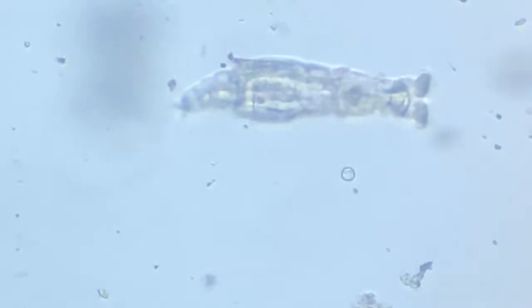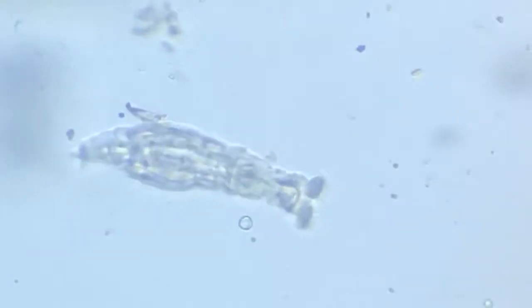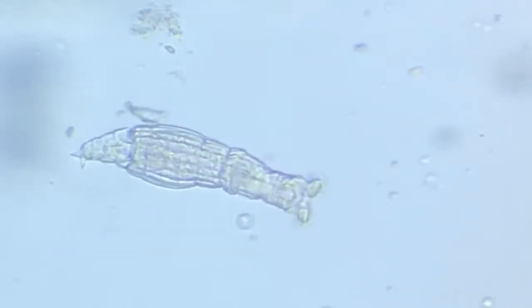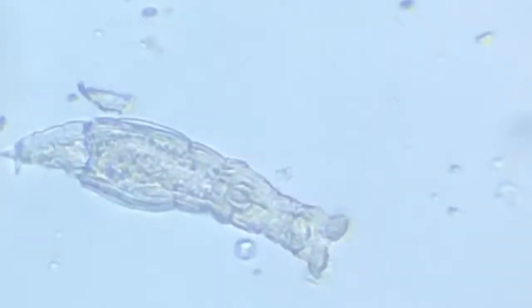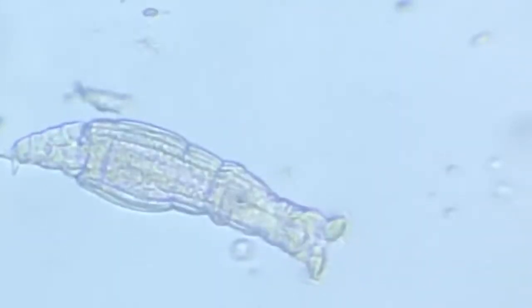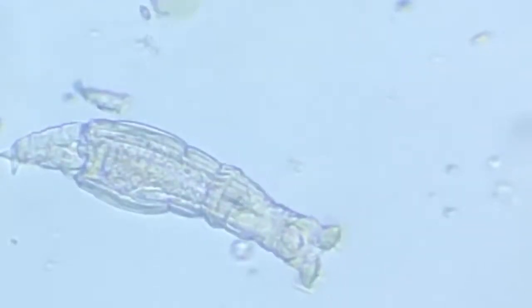The teeth, they are moving constantly and rapidly, which become a mode by which they are classified as well. The stomach in the center occupies most of the part. There is, oh, there comes a, what was that?